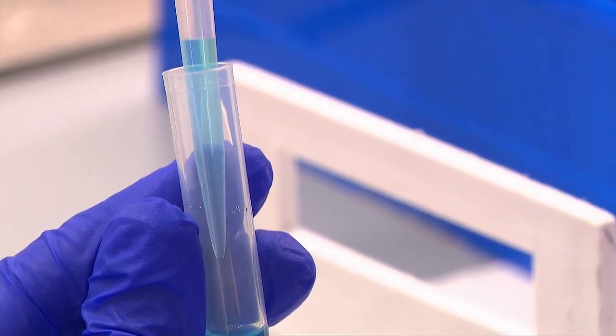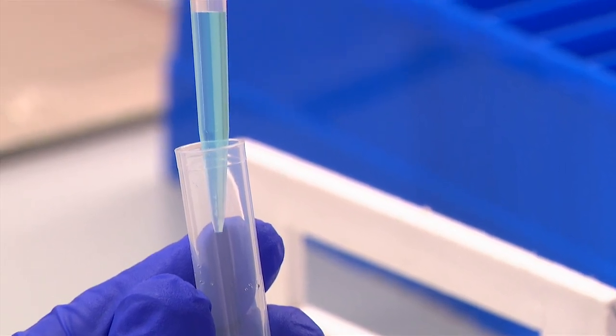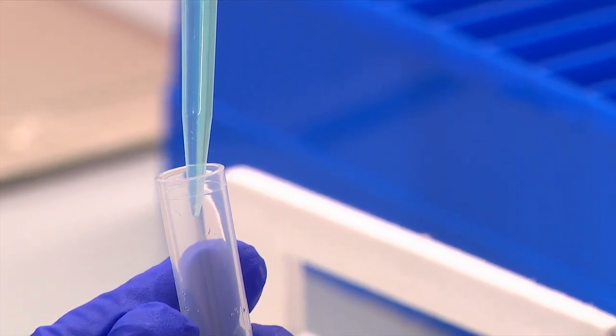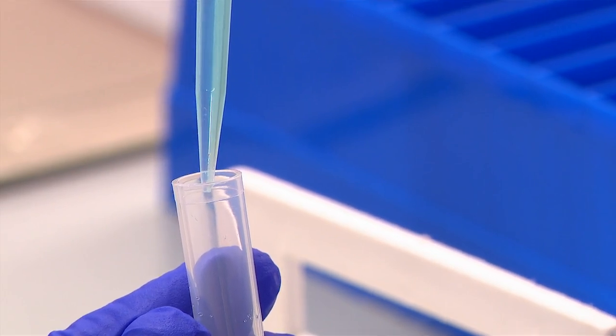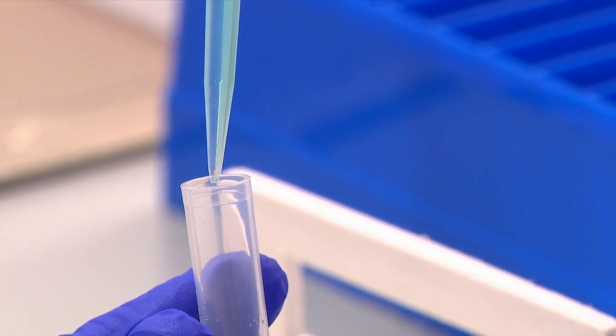Withdraw the tip from the solution and touch the tip against the side of the vessel to remove any solution that may have adhered to the outside of the tip.